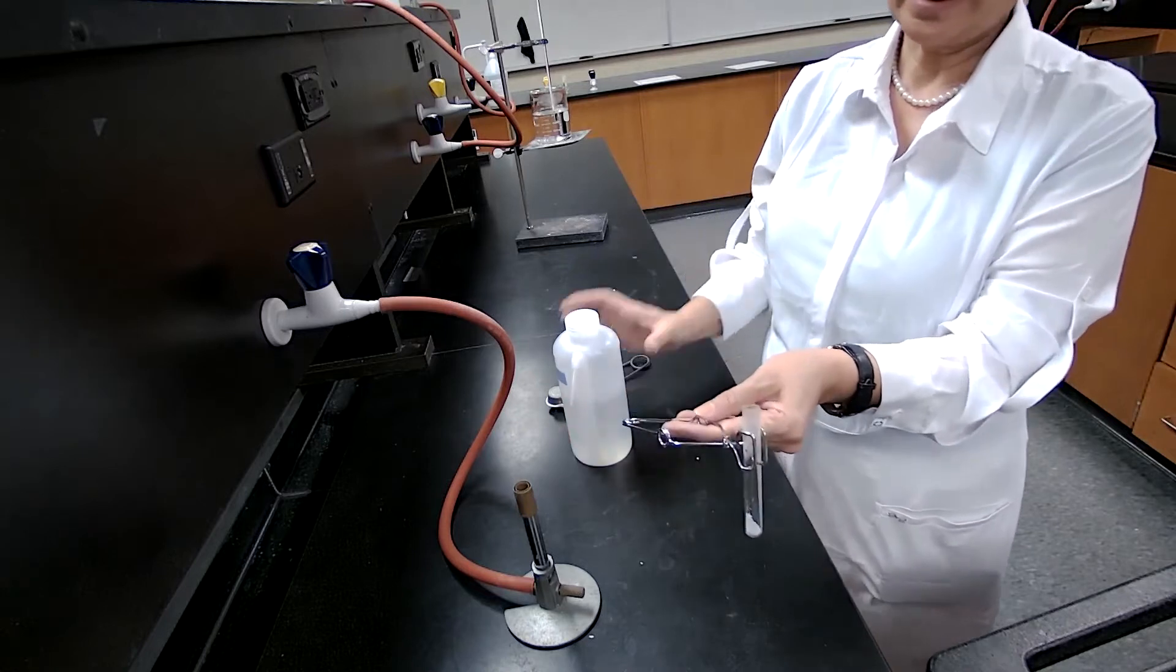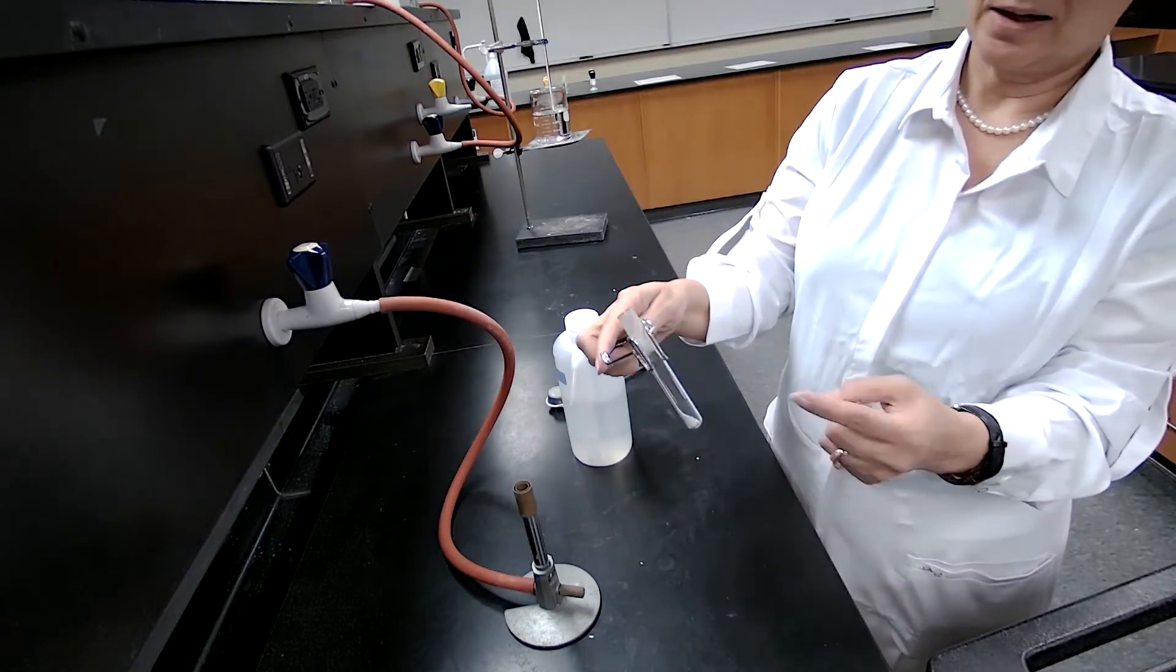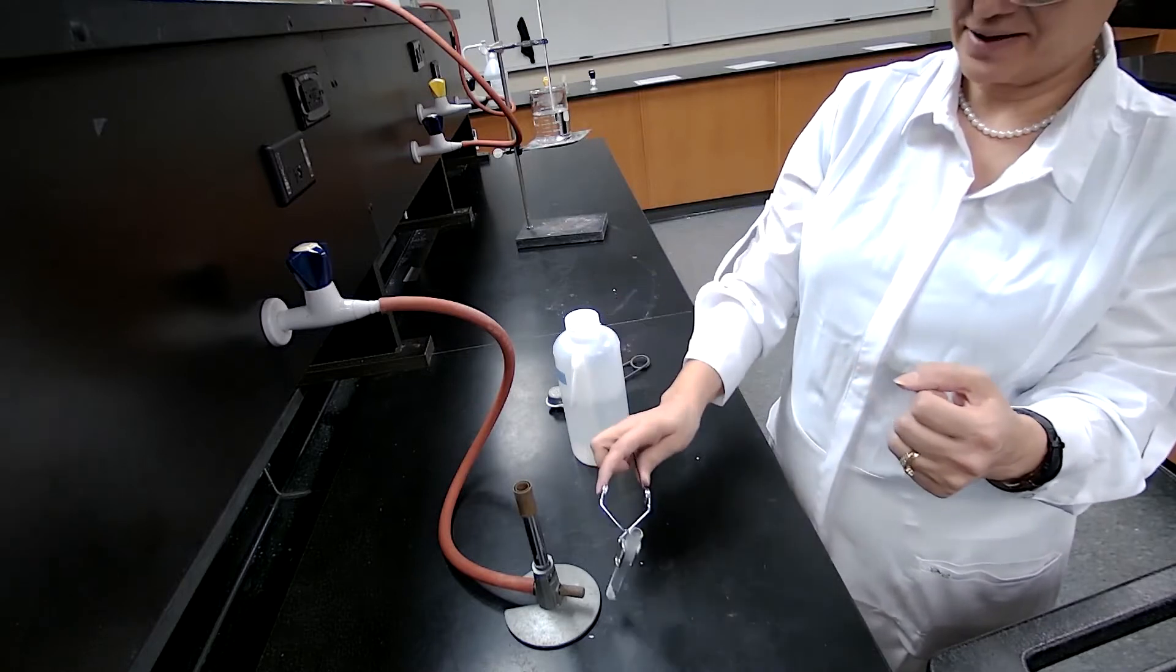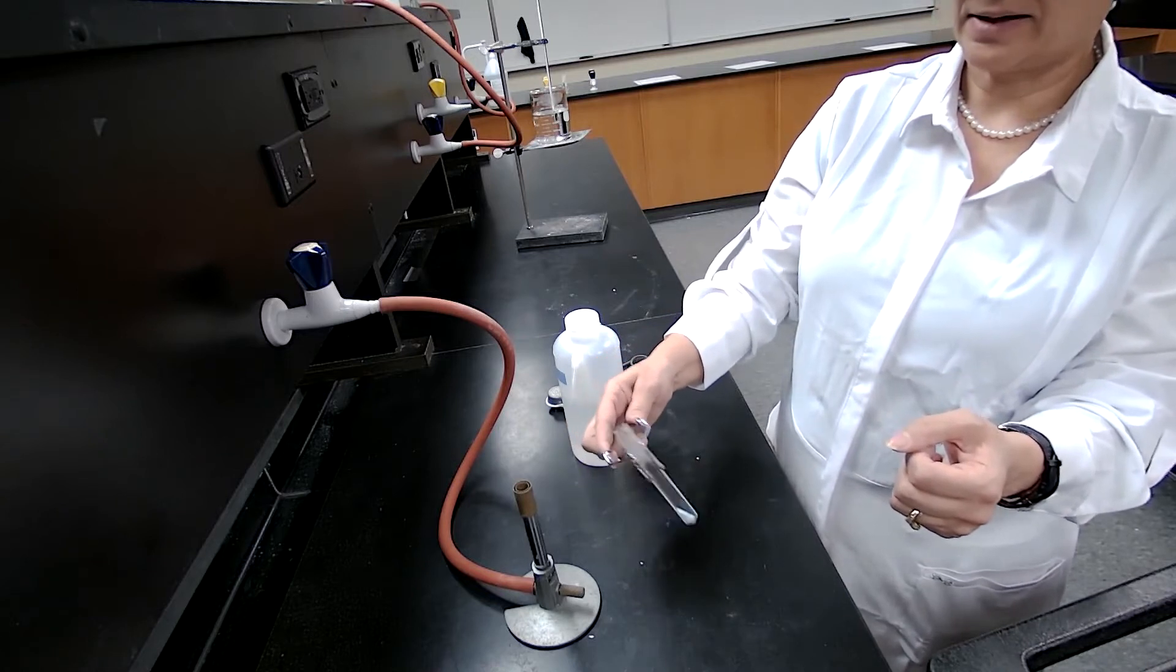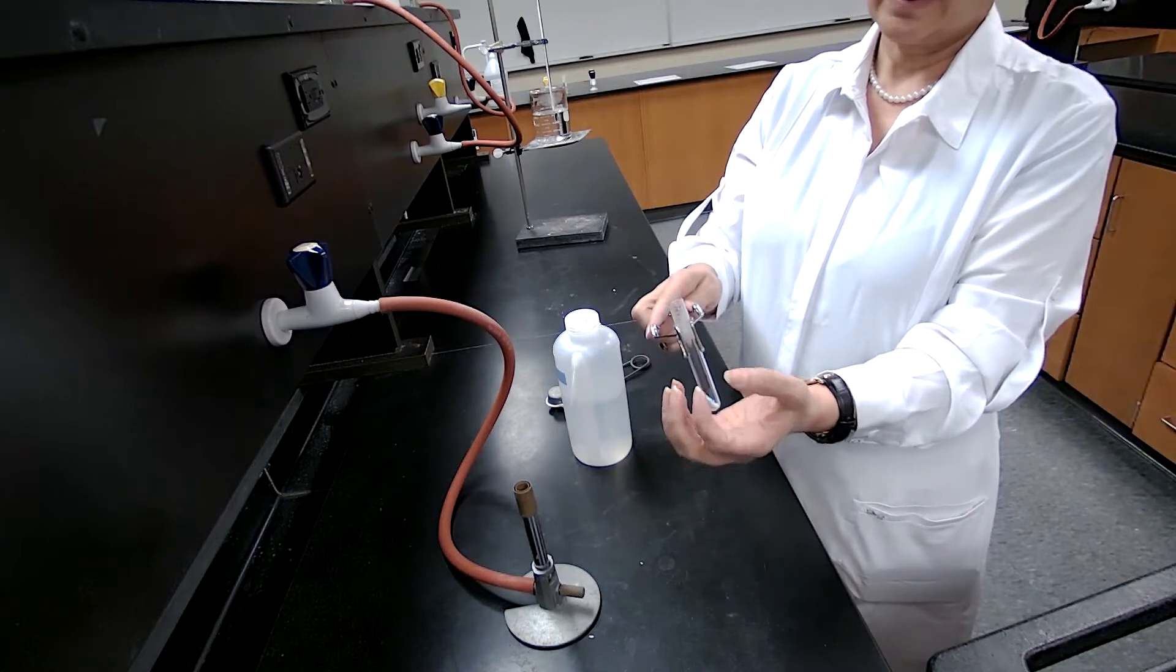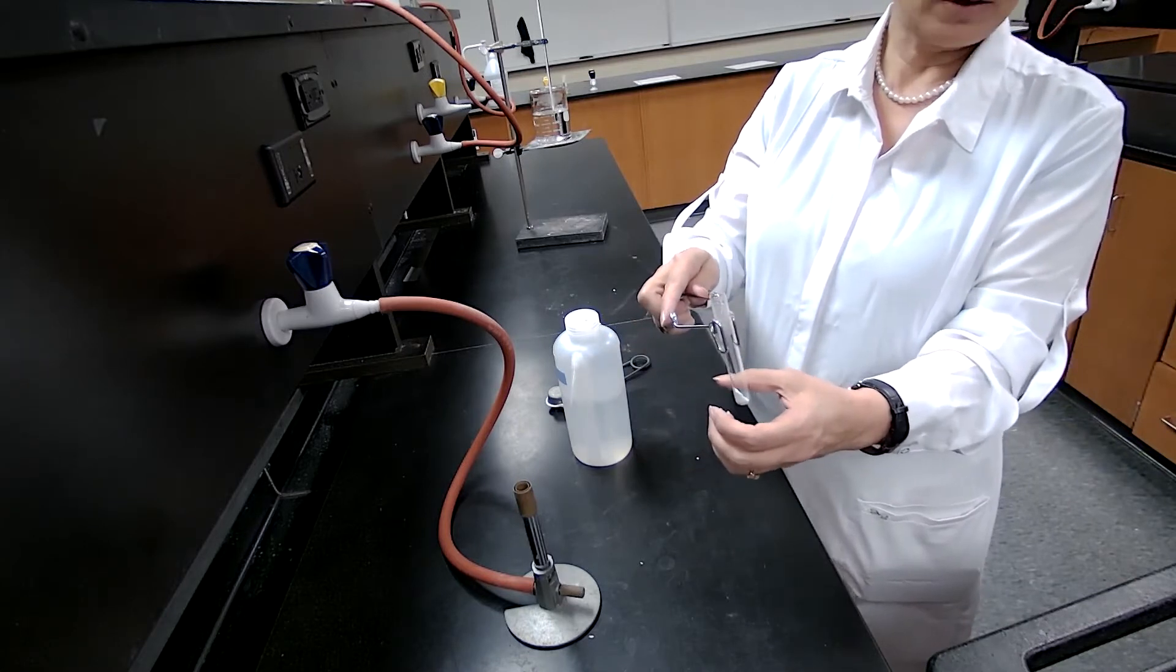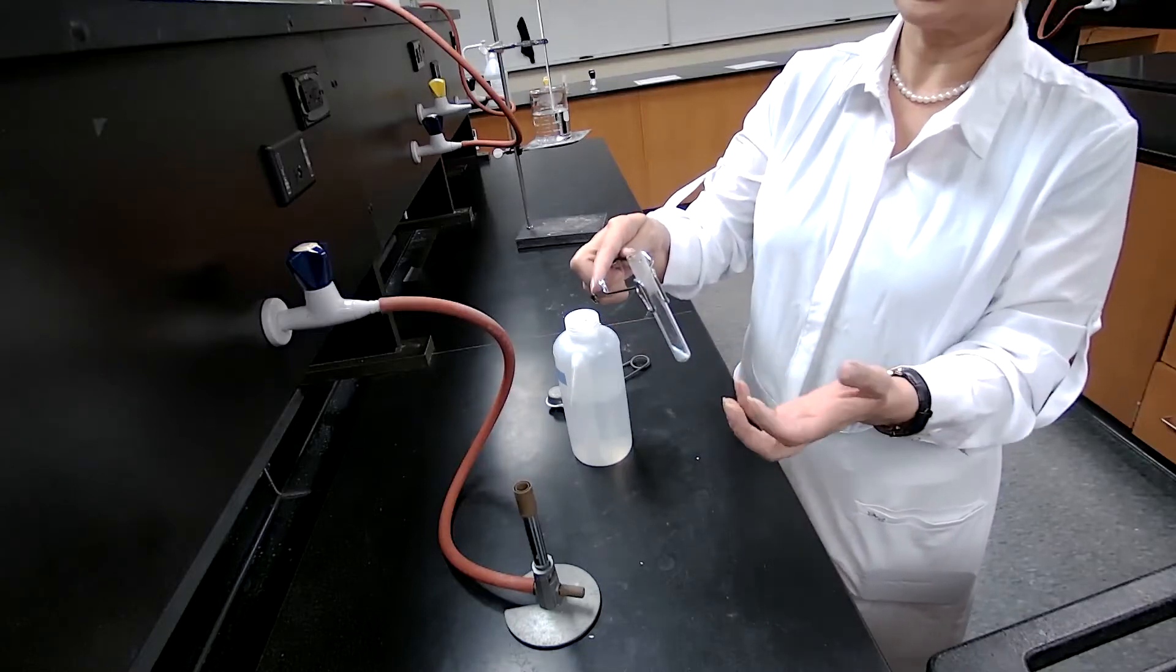So I want to wait, because if the glass is hot and doesn't have any liquid in there, if I add any water it can break, it can shatter the glass. But when I wait, when it's cold, and how do I know it's cold? Of course, hot or cold glass looks the same.